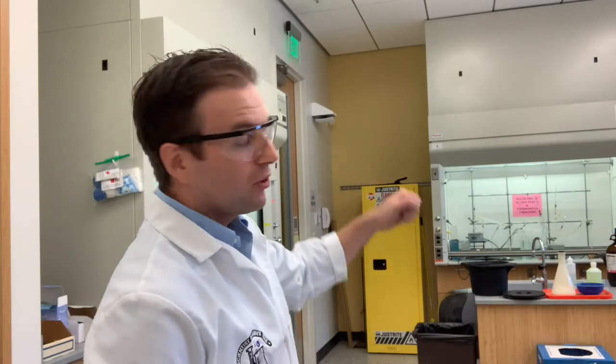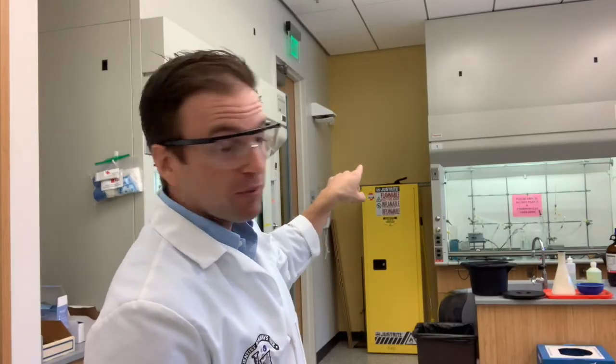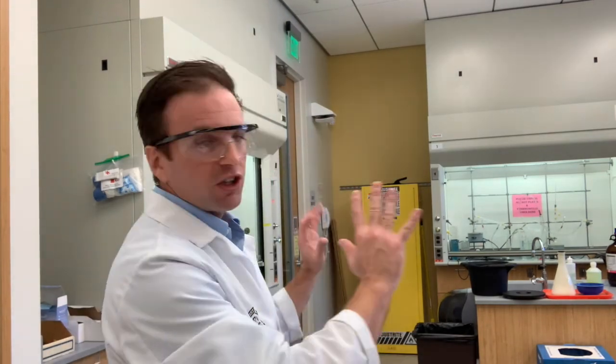Well, that wraps up this video on how to set up your simple and your fractional distillations. In your experiment, you're going to be really careful to measure the temperature of the distillate at each 2 milliliter increment of distillate as it comes out into the graduated cylinder. But for this video, just wanted to show you the setup and things to look for.